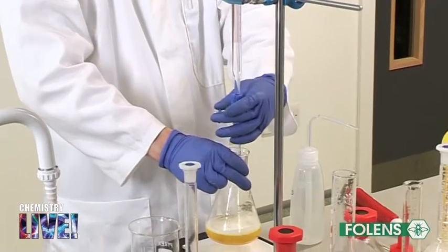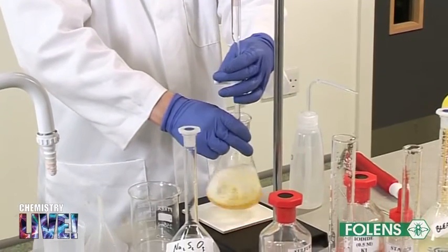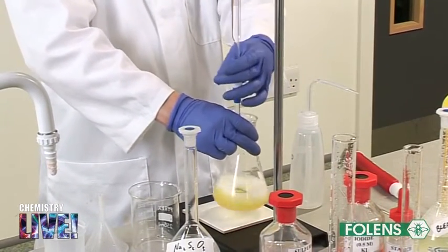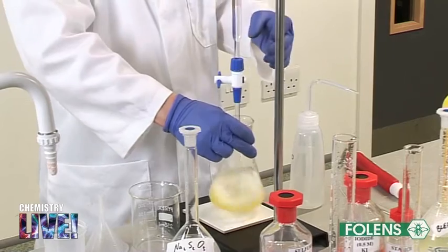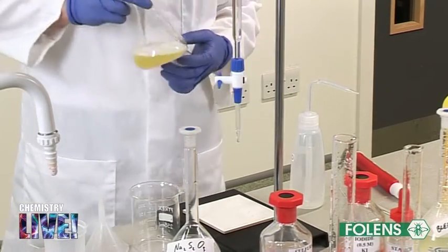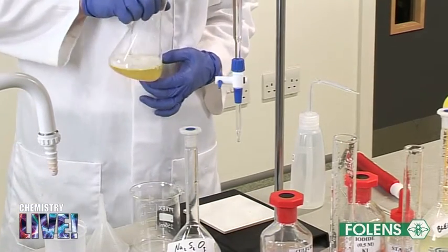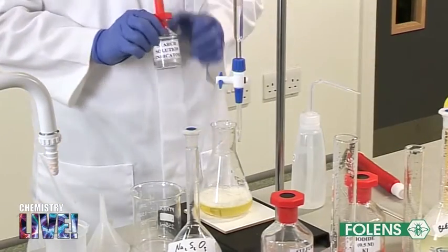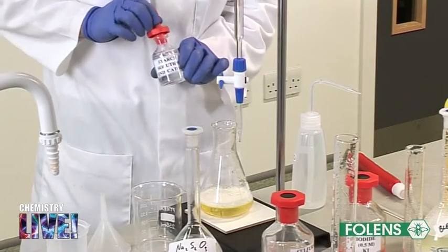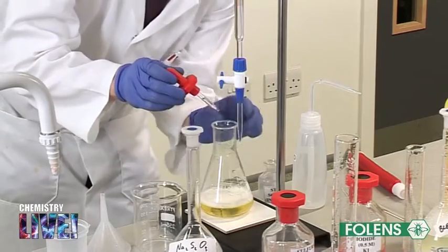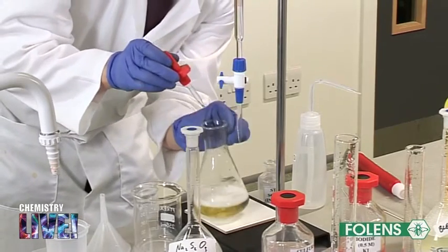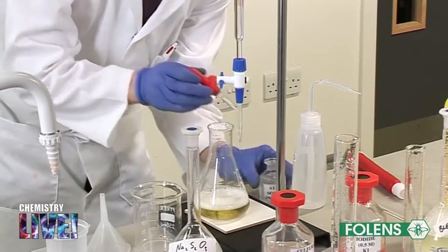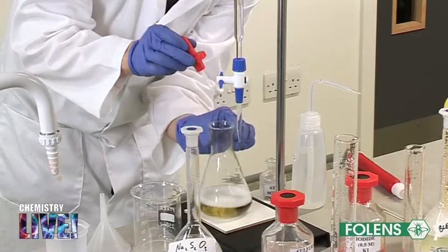Drop by drop. Now add a few drops of starch indicator. Note the blue-black colour that is formed when the starch reacts with the iodine.